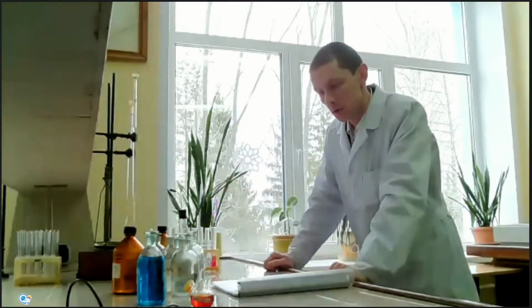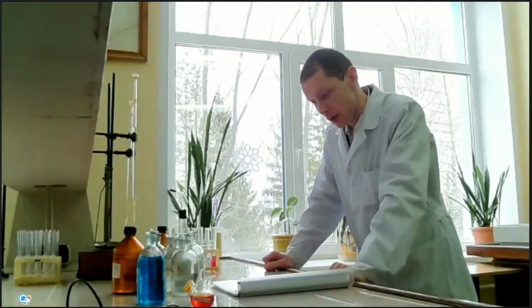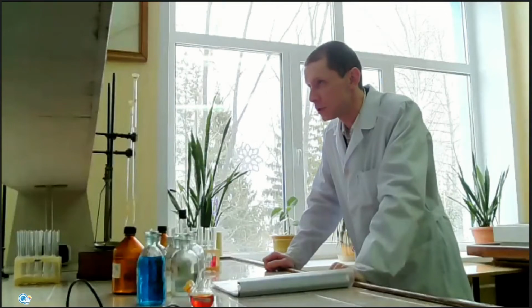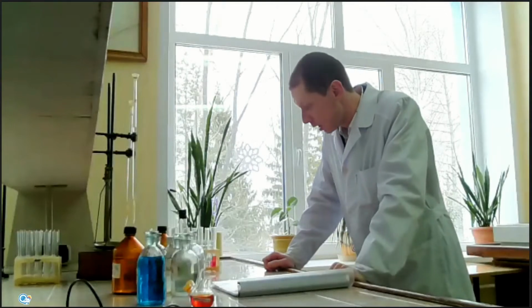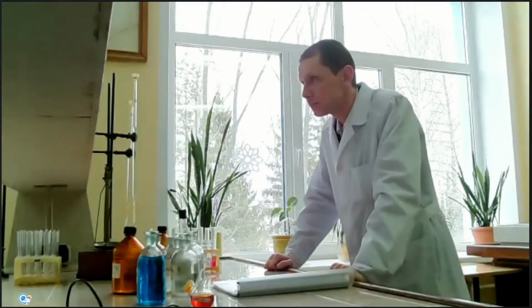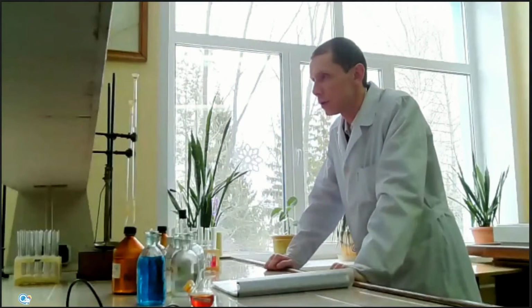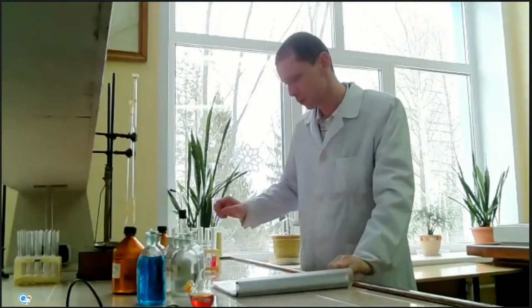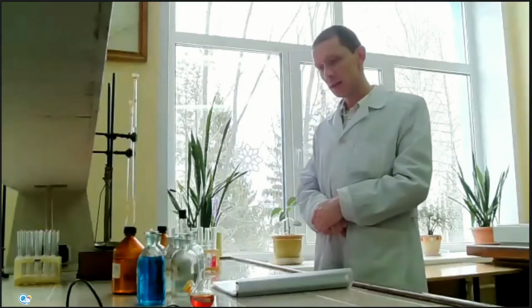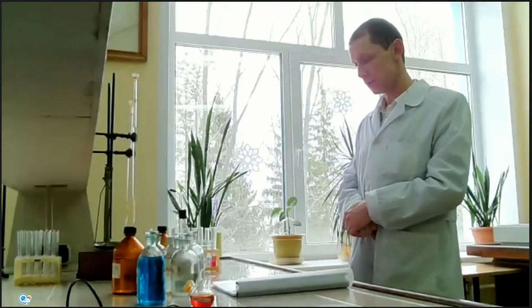Okay, you should also repeat this experiment with aluminum and copper salts. And if you cannot do this experiment, you should think about these compounds and try to think about what you can observe in this reaction. For example, what reaction will occur with aluminum or copper hydroxide with an excess amount of sodium hydroxide. I think the results will be different.